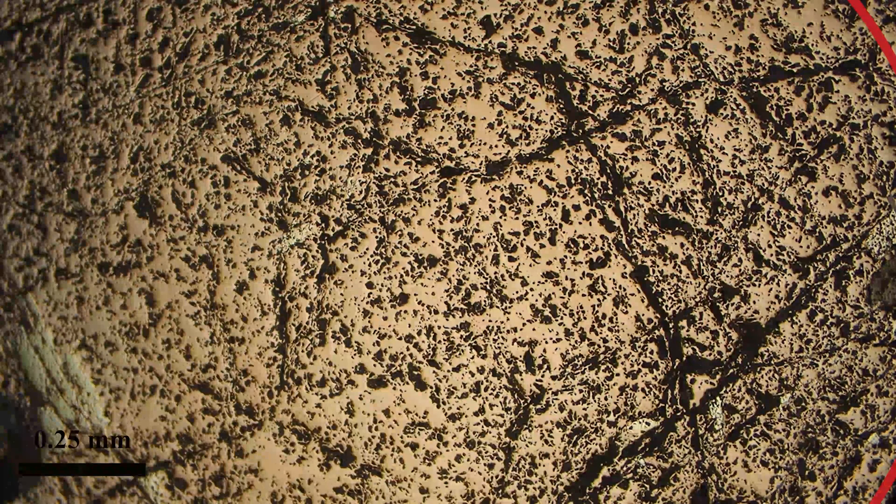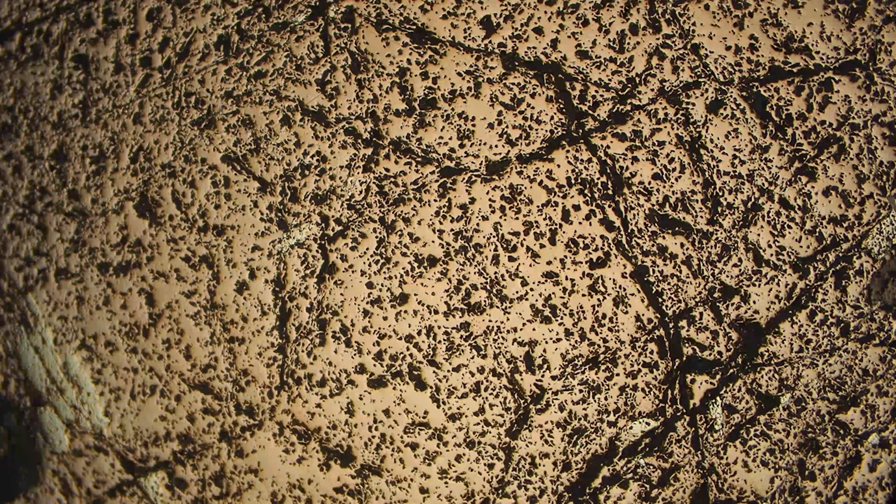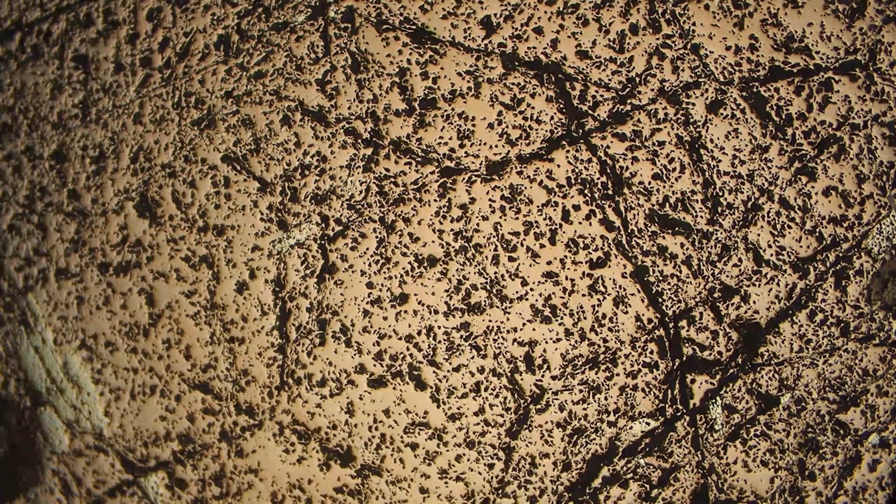Today we're going to talk about identifying magnetite in polished section. Here we have our magnetite — it's gray with a slight brownish tint. As we rotate the stage, you can see that there is no change in color or brightness, so there's no bireflectance.